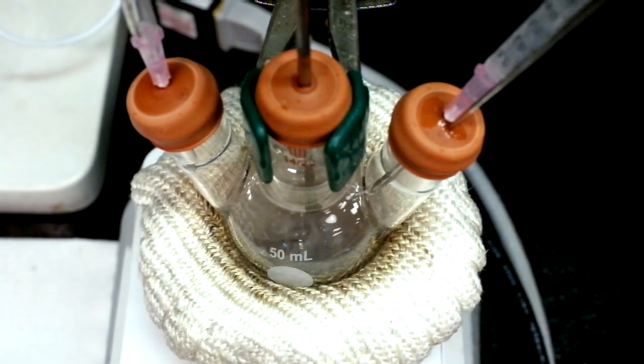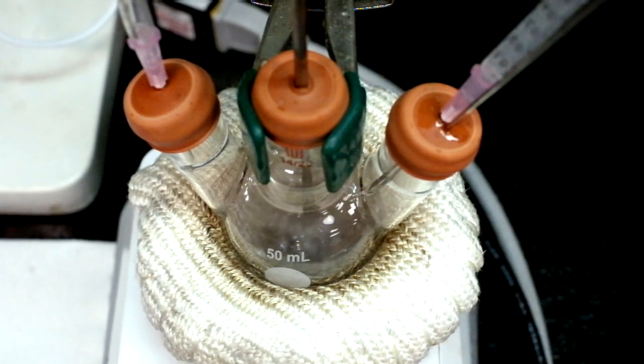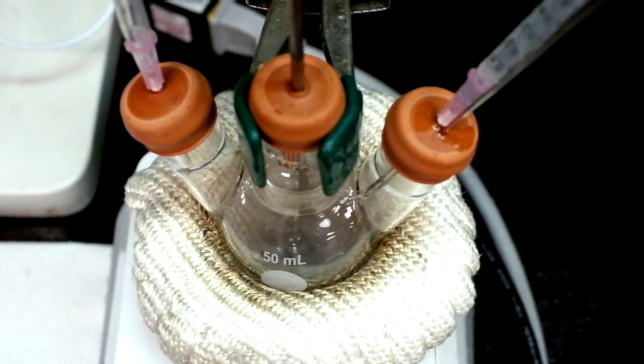When the reaction begins, the solution will turn a yellowish-brown color and as more shell is added, it will become a darker brown.